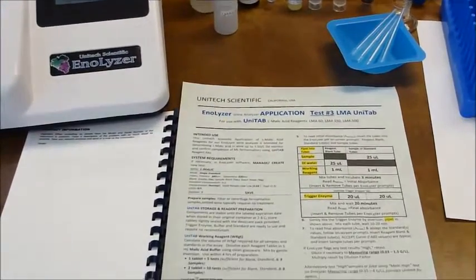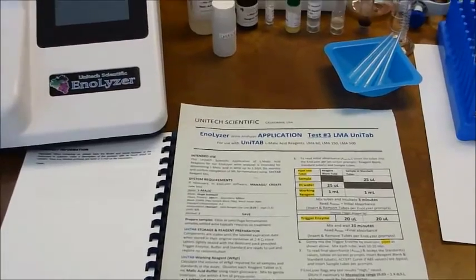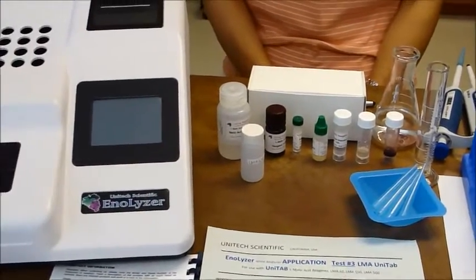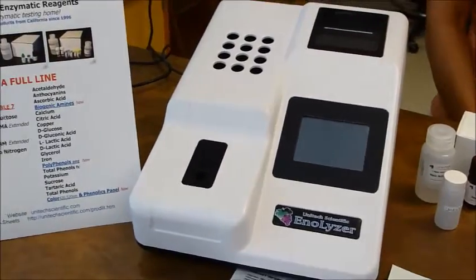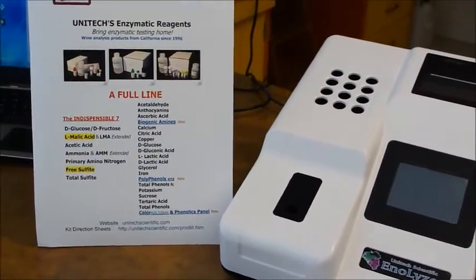First, a note on sample prep. If testing fermentation samples, filter or centrifuge the sample prior to testing — we need clear wine samples.